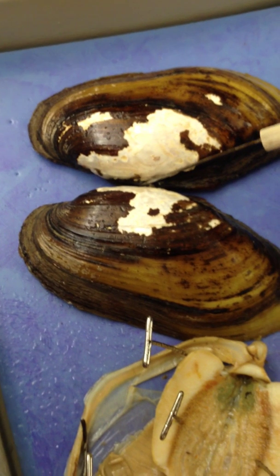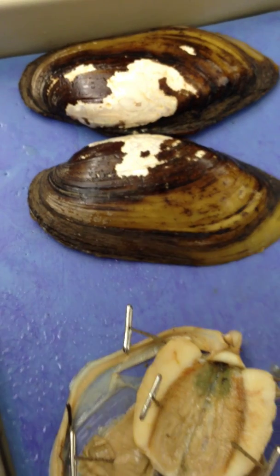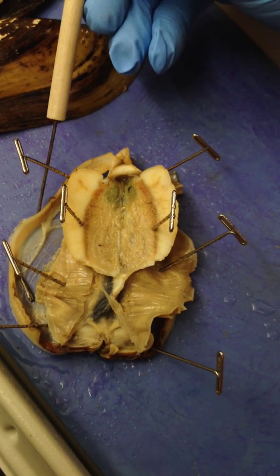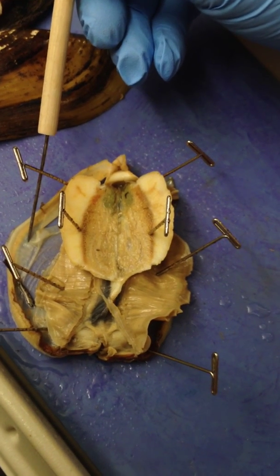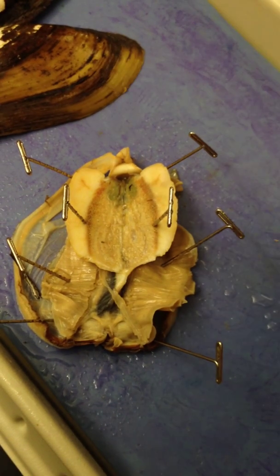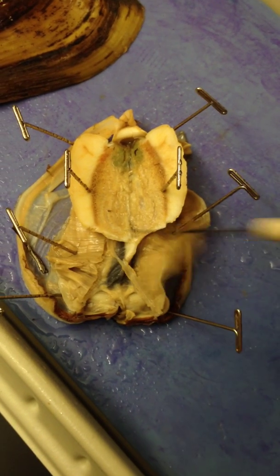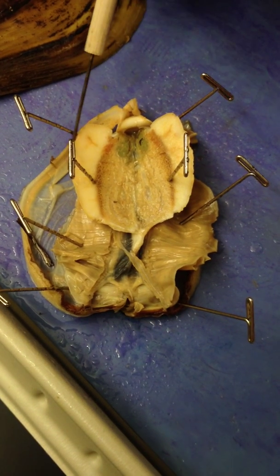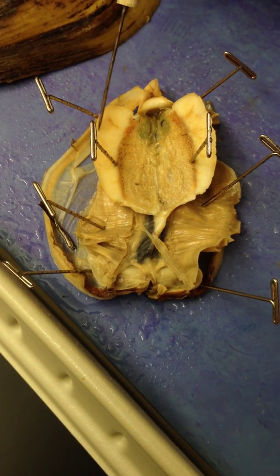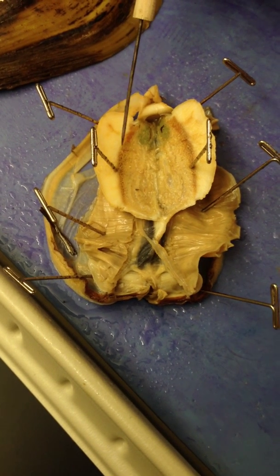This is the back, so the dorsal side and the ventral side. Moving to the actual clam itself — overview first — we've got the mantle, which sits flush against the nacreous layer and makes the shell. Just inside of that, you have the gills; there should be two layers on each side. The white area in the center is the muscular foot, used for locomotion.